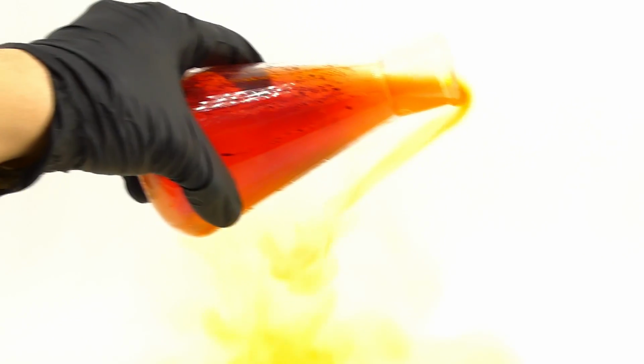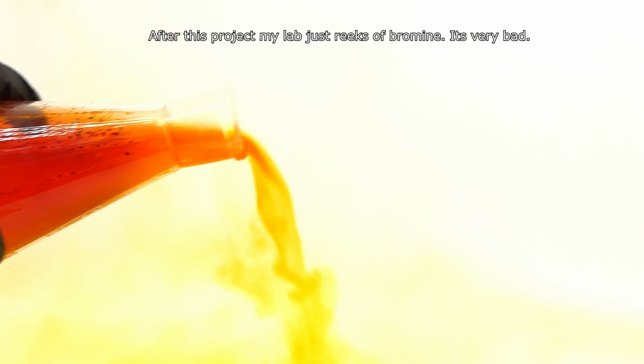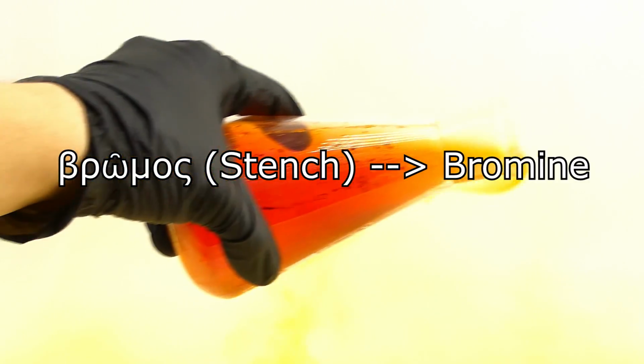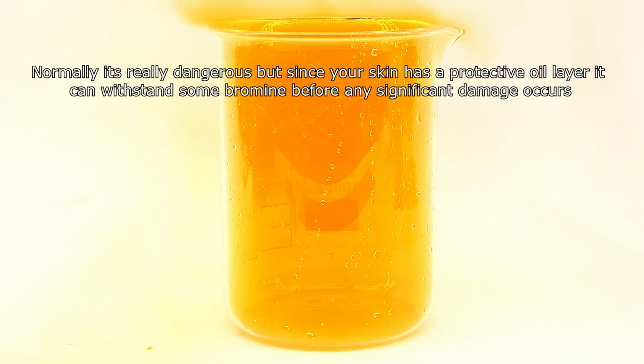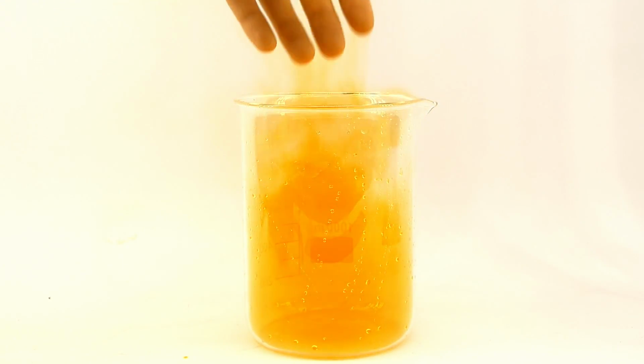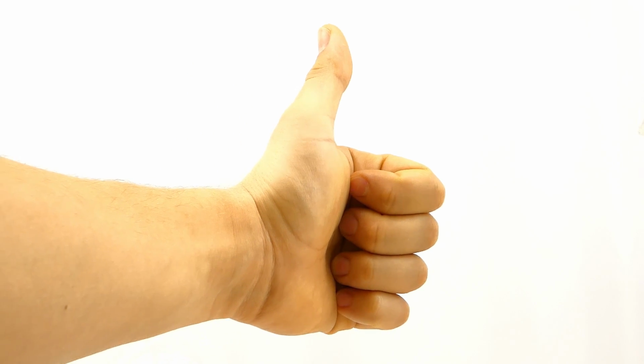Bromine vapor is really heavy and tends to accumulate on floors of rooms, destroying everything in its path. It also smells pretty bad, similar to chlorine, and this smell is actually the reason for the name bromine, which came from the Greek word bromos, meaning stench. Since bromine's vapor is so heavy, it can be poured similarly to a liquid, and I can easily fill a beaker with it. Also, despite bromine being very reactive and dangerous, it is not too toxic for your skin, and for science, I put my hand into its vapor and felt the heat of my hand being brominated, which was quite terrifying, but in the end I was completely fine.